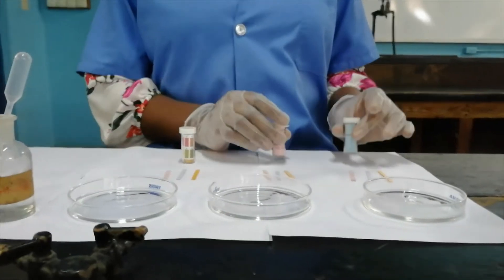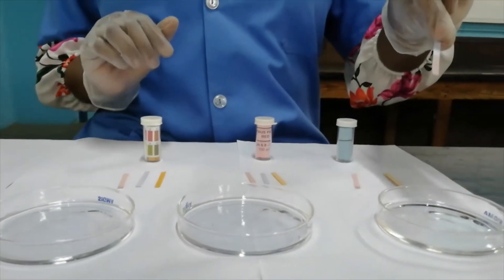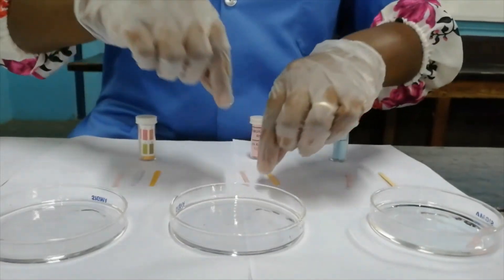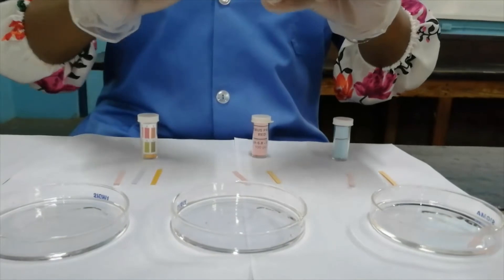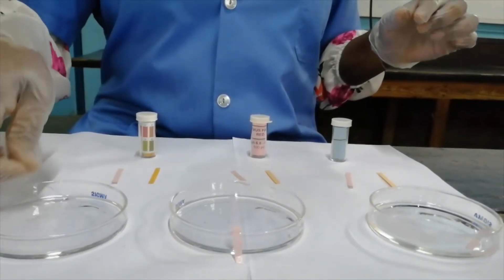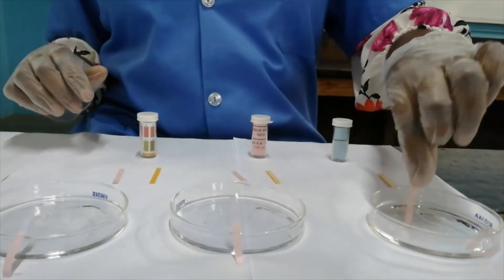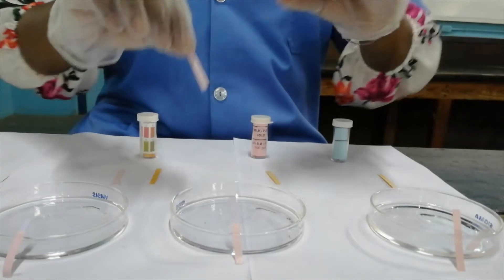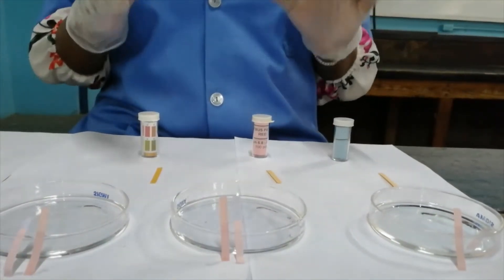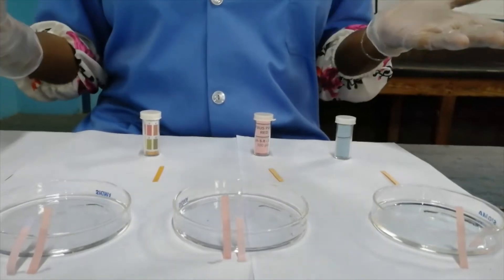We have these three acids, so let's look at the effect of acids on blue litmus paper. Blue litmus paper changes to red — this pink color we call it red in the lab. Let's look at the effect on blue litmus paper with the next acid — it also changes to red. It doesn't matter which acid you use; once you put blue litmus paper in an acid, it will change to red. Red litmus paper placed in an acid remains red. The key point: blue litmus changes to red. If you don't have blue litmus, use red litmus — if it remains the same, you know it's an acid.